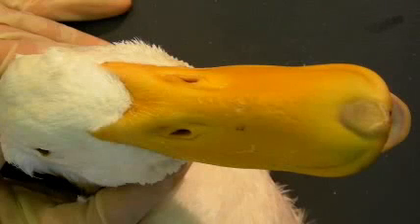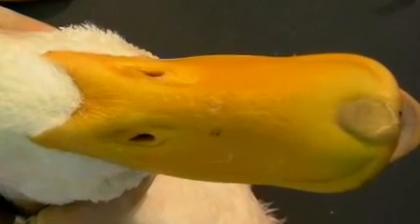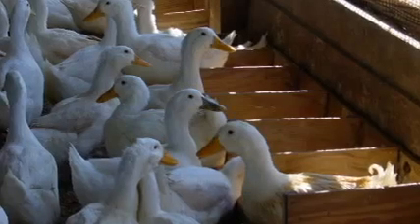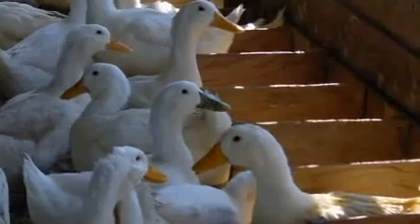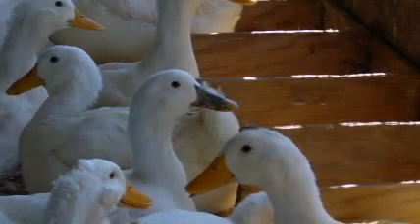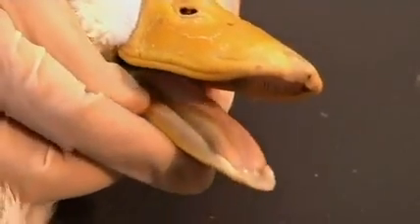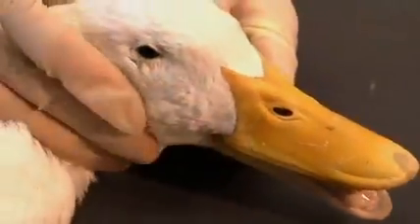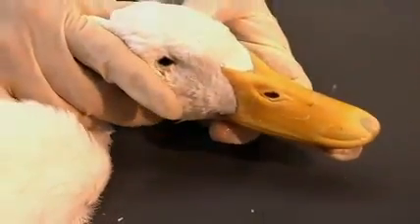It is flat and has a soft, leathery texture. The color of the bill varies depending on the breed and physiologic state of the bird. Duck hens may develop dark spots or streaks on their bill at the onset of lay, caused by hormonal changes. Note any malformations of the bill. Interruption of bill growth can result in twisting and misalignment.